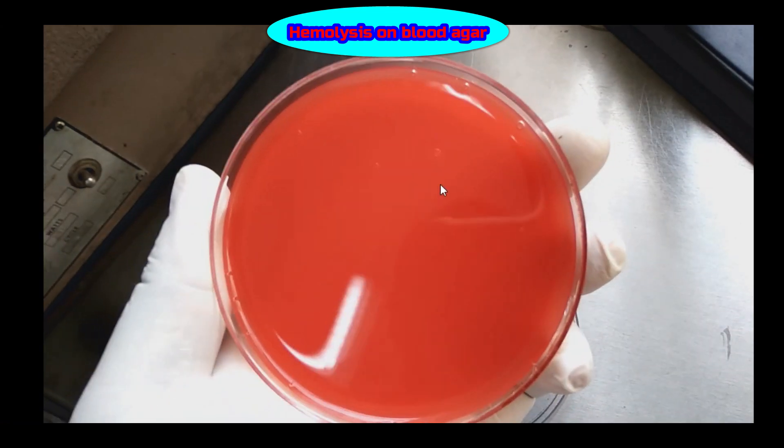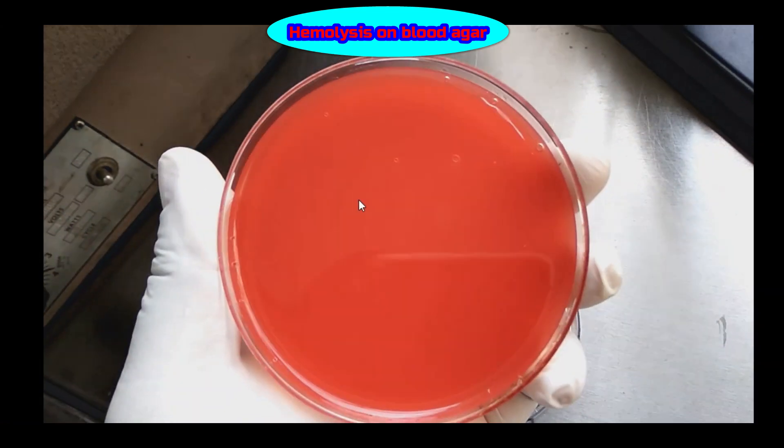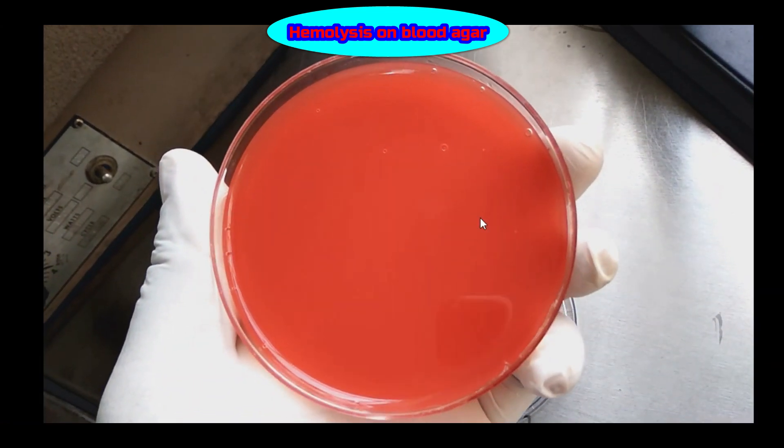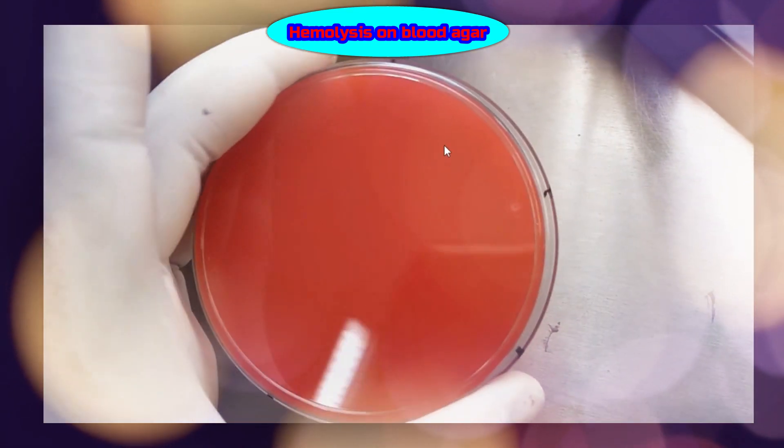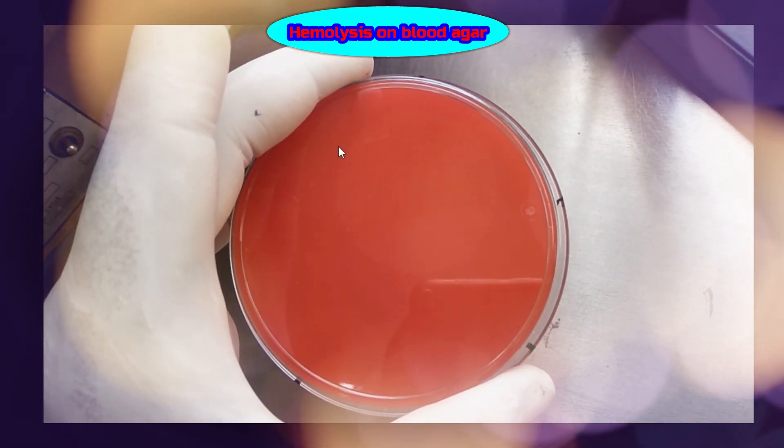This is the medium without inoculation specimen. After inoculation with the specimen and overnight incubation, here we can see the beta hemolytic colonies, because there is a clear, colorless zone of complete hemolysis.